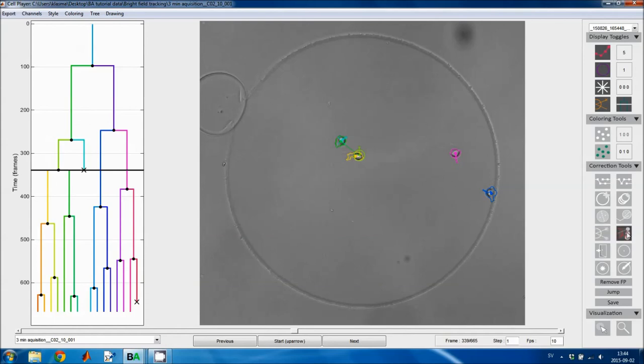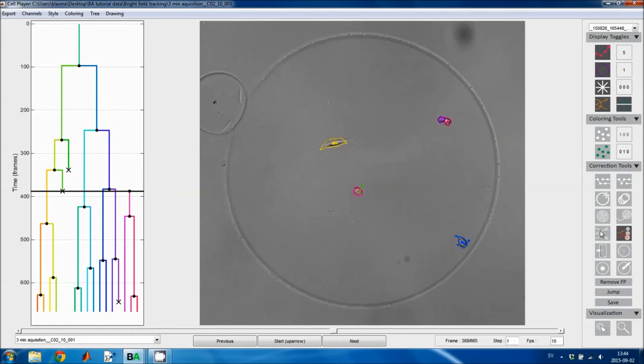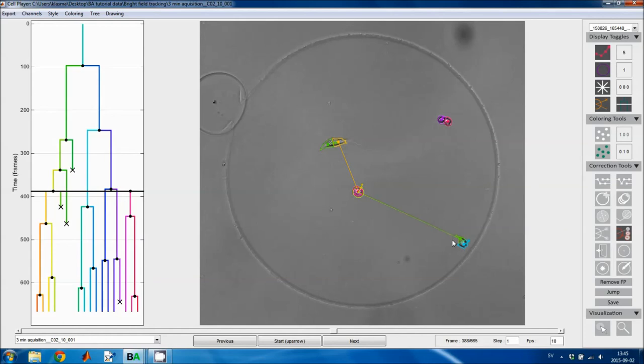The next tool does the same thing, but instead of, I think I'll move a few frames forward so that you don't become confused. The next tool first creates the mother cell by clicking on the center point of the previous image, and then I click on the two daughter cells, and the cells that I click on will be copied from the current frame onward. So I duplicate cells, and the copies become daughter cells of the mother cell that I just clicked on. So here I've duplicated that cell, and then I'll duplicate that cell.